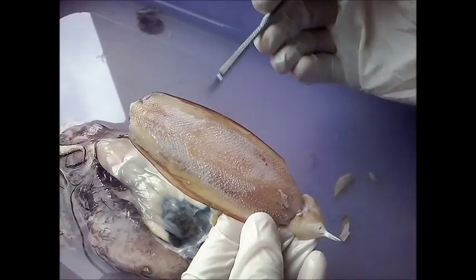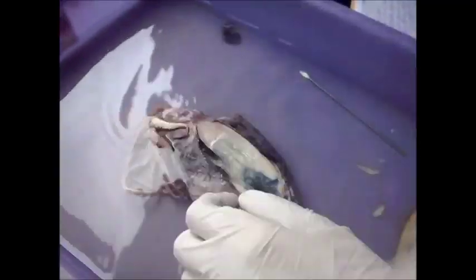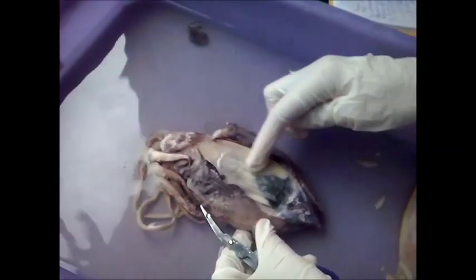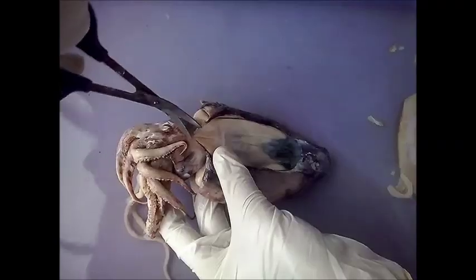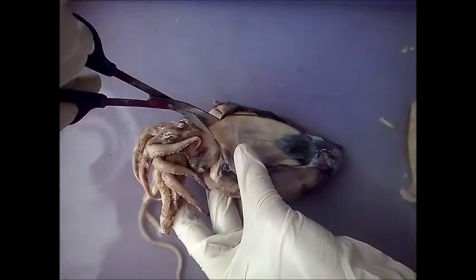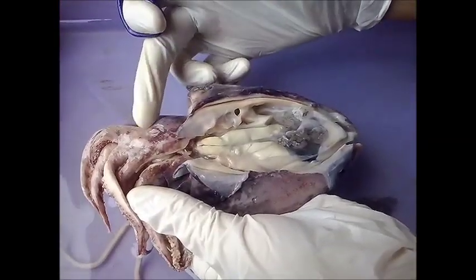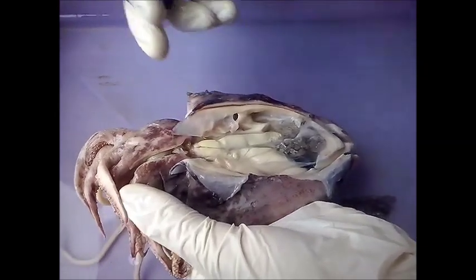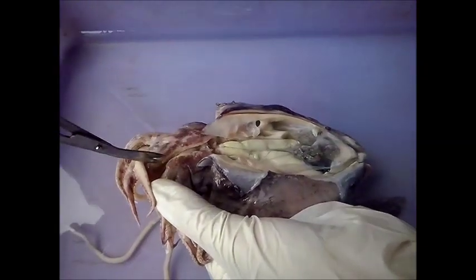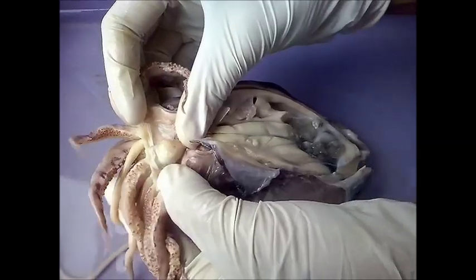We shall now be exposing the digestive system. In order to do so, you can see that there is a membrane covering it. We shall cut that membrane by making a cut from the anterior towards the posterior side. The digestive system — that is, the mouth — lies inside the head, which is why we have to cut open the head starting from the anterior side, in order to expose the mouth.